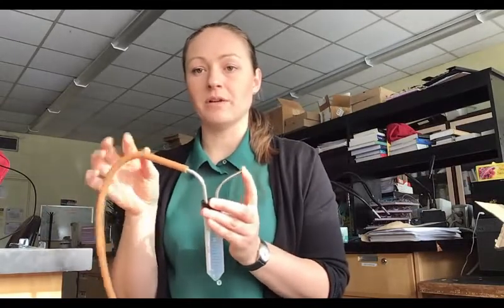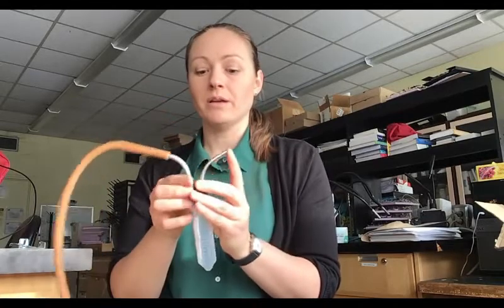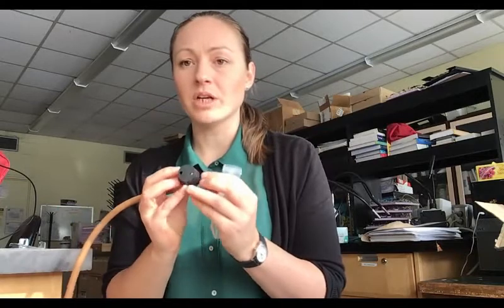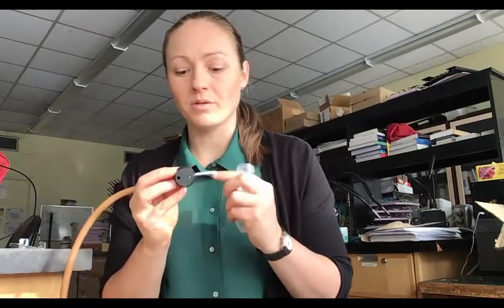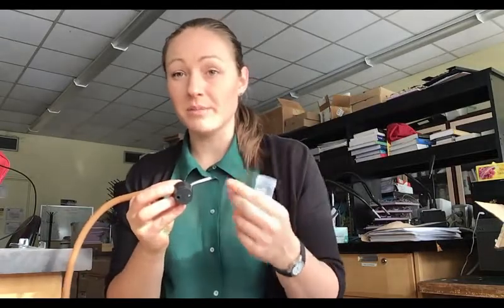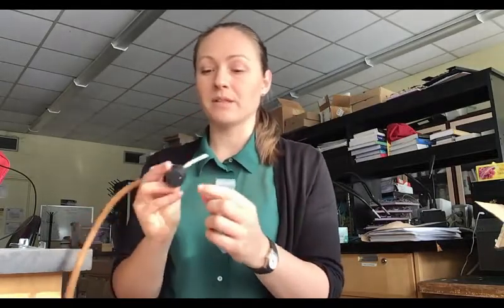There are two different lengths of metal straws here. The shorter one goes to your mouth and the longer one is where the mosquito comes up and gets caught in the tube. If you're ever unsure, you can check the bottom here—the one that goes to your mouth has a screen over it so you can't inhale the mosquito sample, which is important.